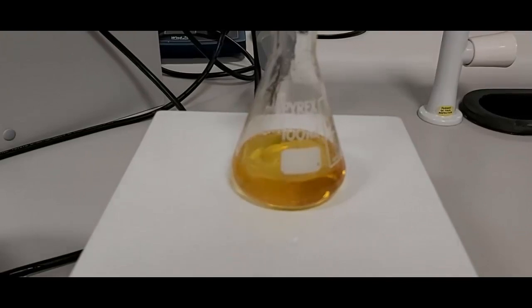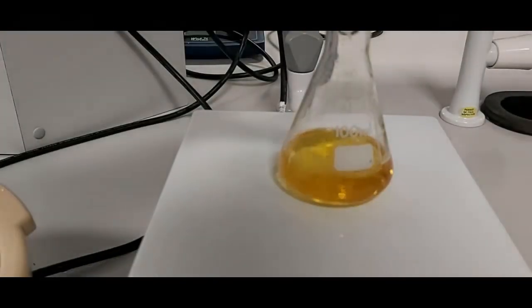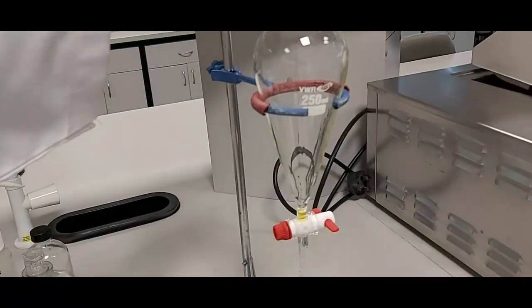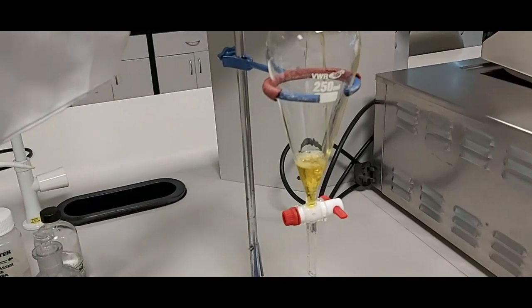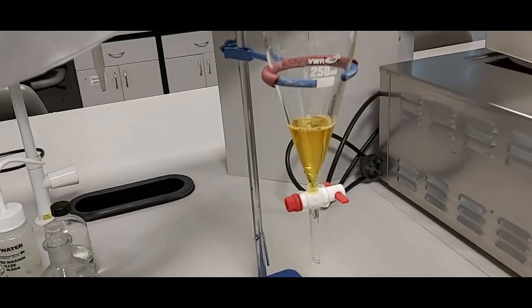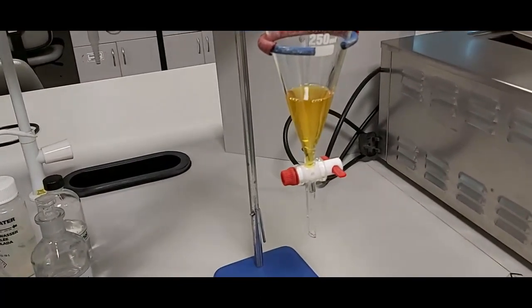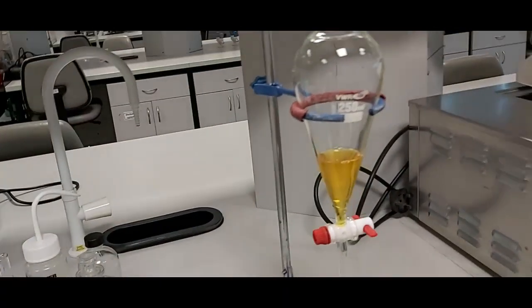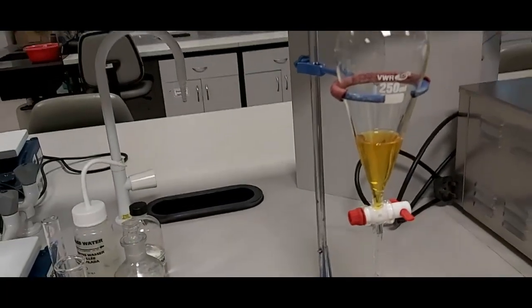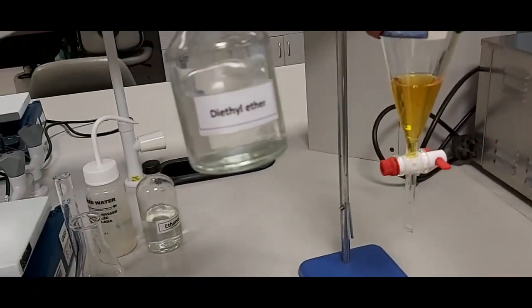We heat the reaction for one minute, then cool the mixture to room temperature using ice. I transfer the solution to the separatory funnel, then perform the extraction using diethyl ether. I will add two portions of 20 ml of diethyl ether.